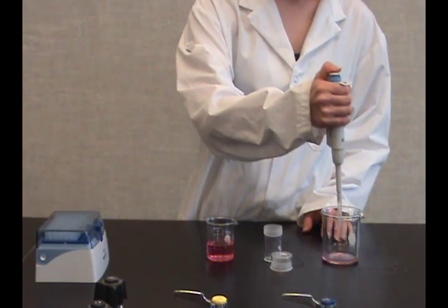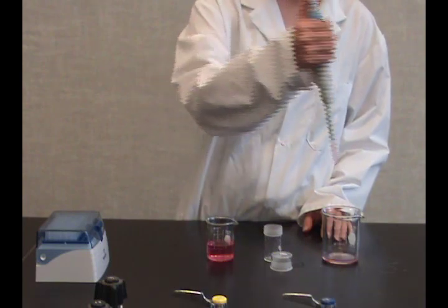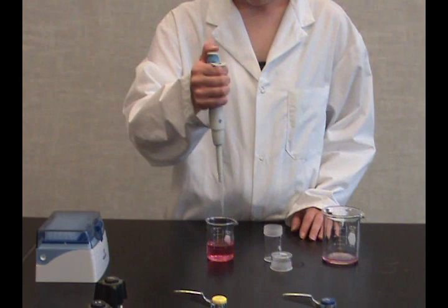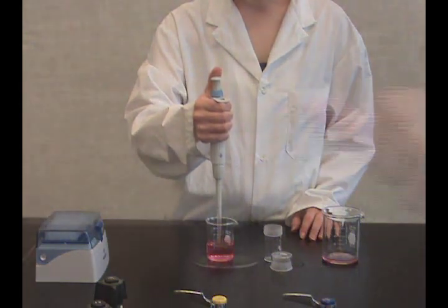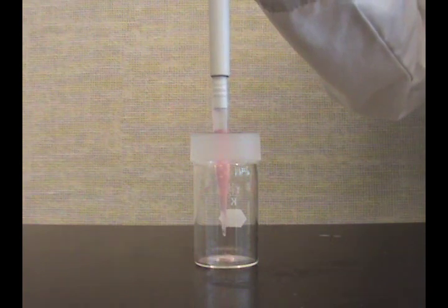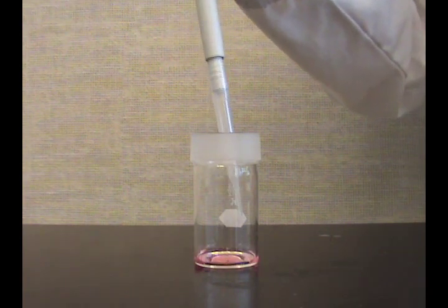Do this two more times to rinse the tip with solution. After three rinses, draw up the sample and deliver this to a receiving vessel. Touch the tip on the side of the vessel to remove any drops left on the tip.